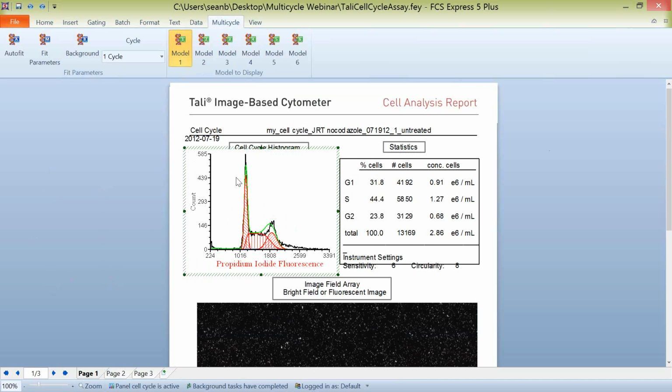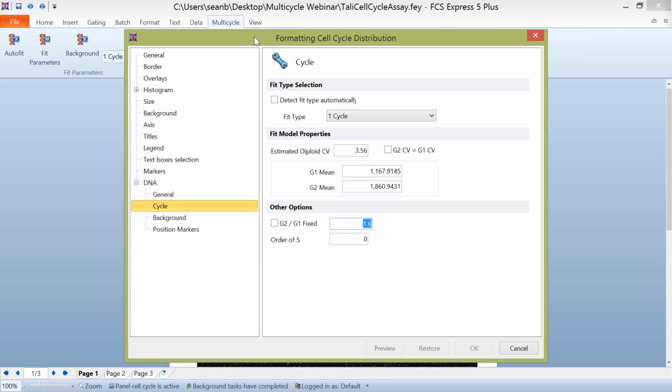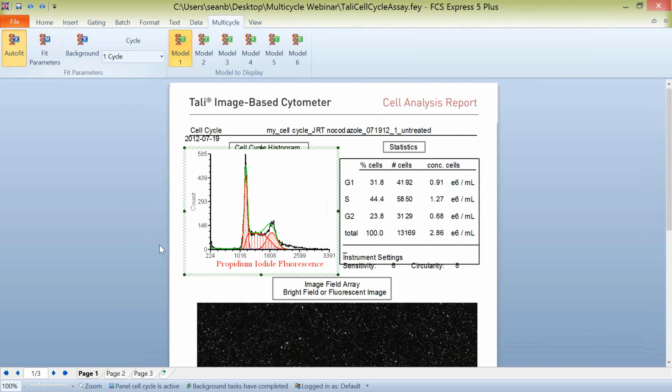But this is because we've unchecked the auto fit, and what we did with this particular data set was we came into the cycle and we said use a value of 1.6. If we were to turn our auto fit back on, you can see that when we auto fit the data, this is what Multicycle determines as its best fit for this data. And of course, it looks like this does not make sense for this particular data set. And for whatever reason, when somebody had imaged this data, the G1 to G2 values, even though they exist, and we can see that in the histogram, they were closer together than the model would expect.